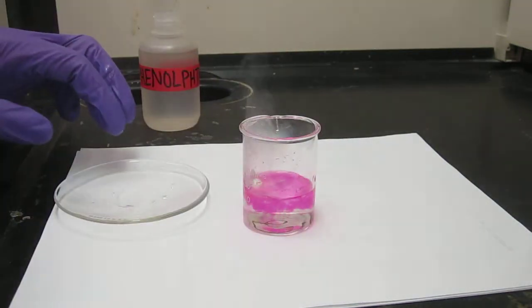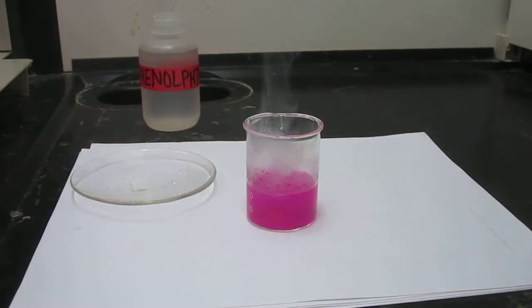Then let's just put it in there and you can see that the phenolphthalein went from clear to pink quite quickly. You can see the reactivity of the sodium metal as well.